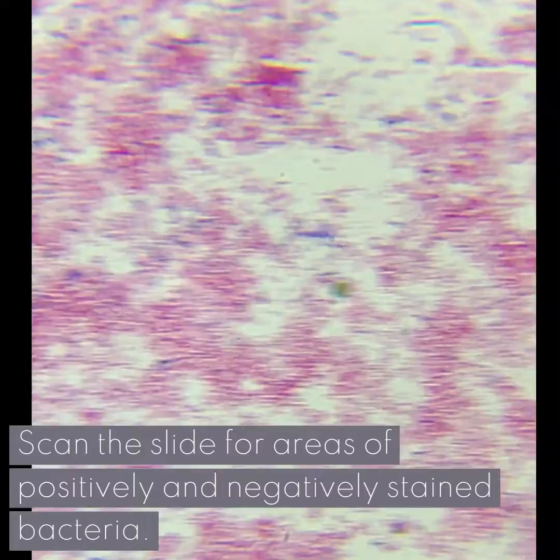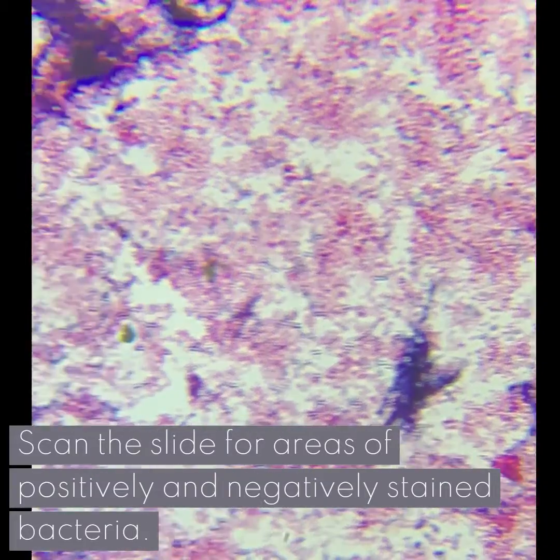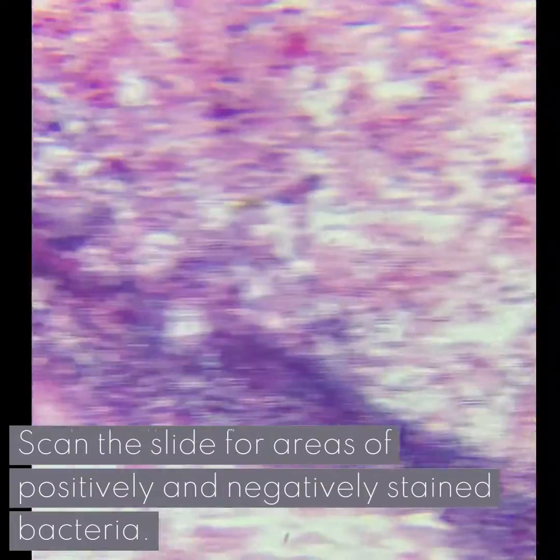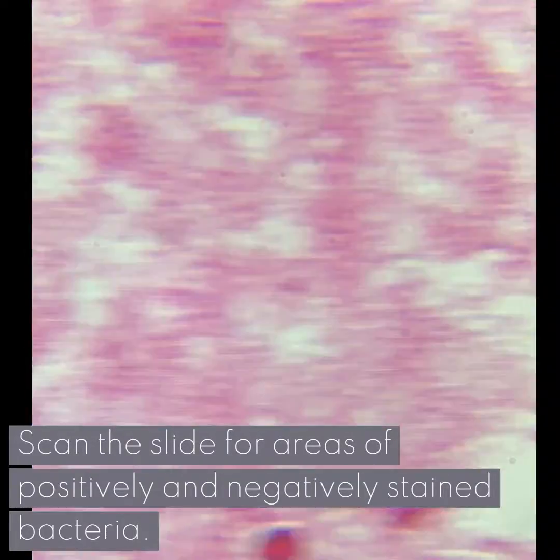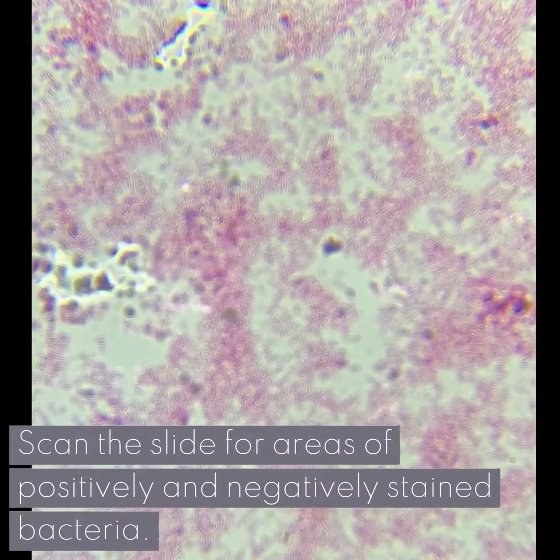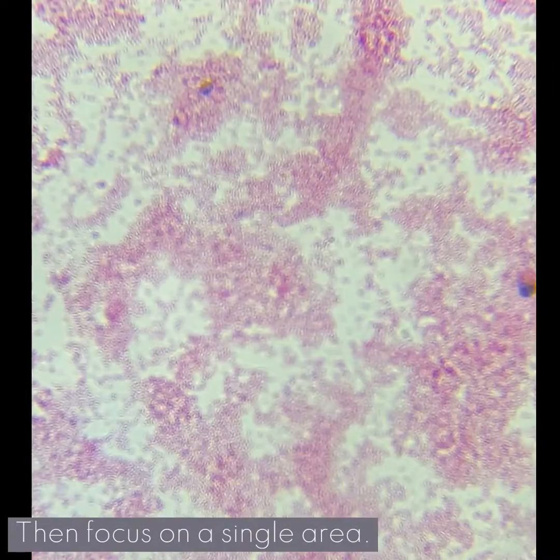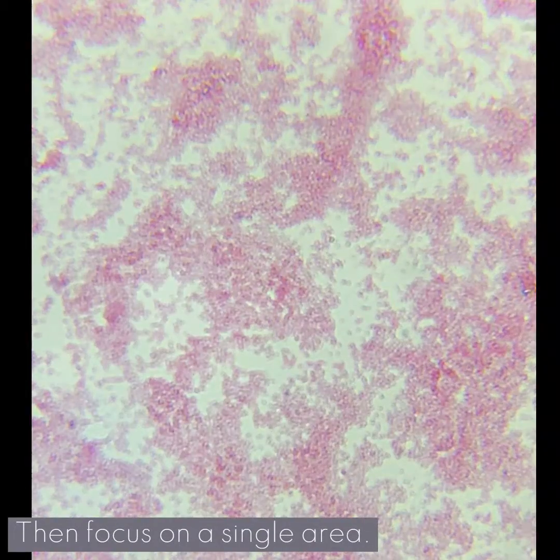Scan the slide for areas of positively and negatively stained bacteria, then focus on a single area.